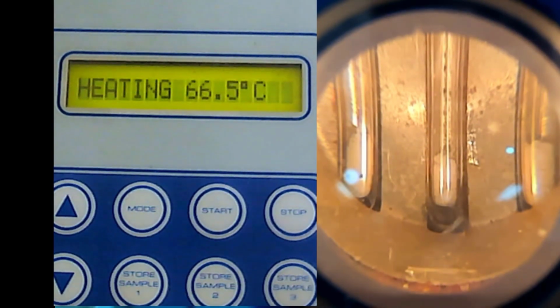So students end up going back later. But here I'm using the two instruments simultaneously, so that speeds up the thing. If not, you need to wait long.